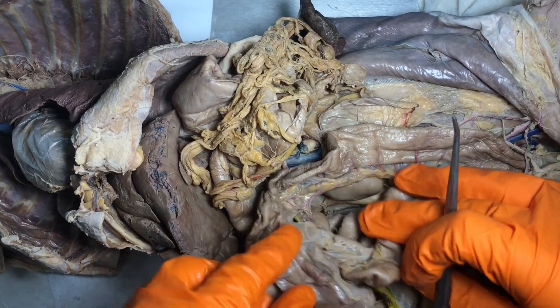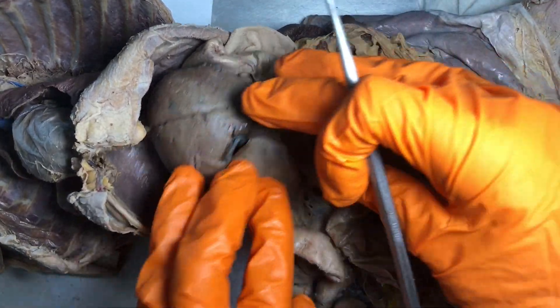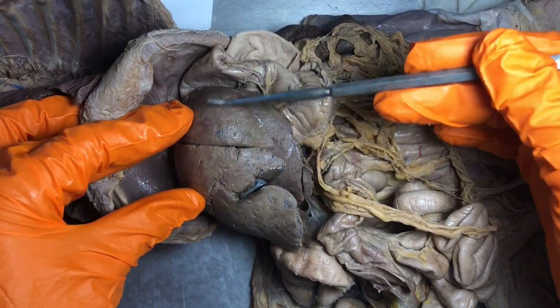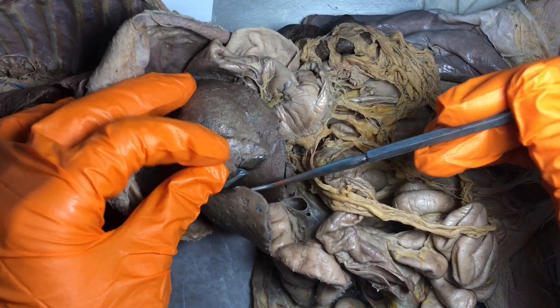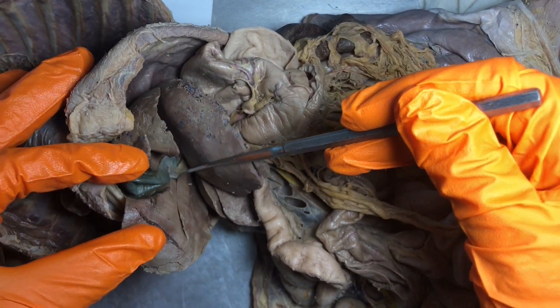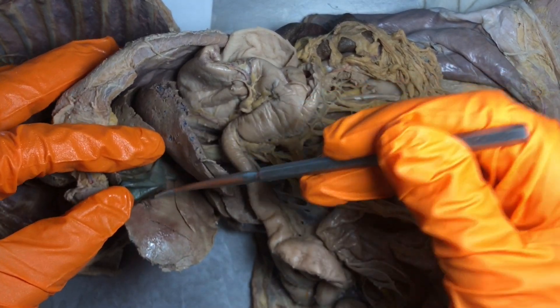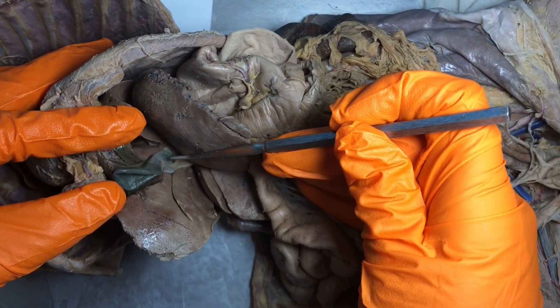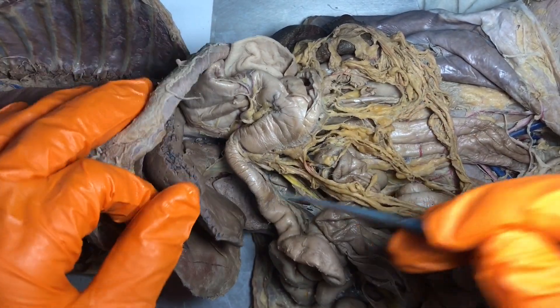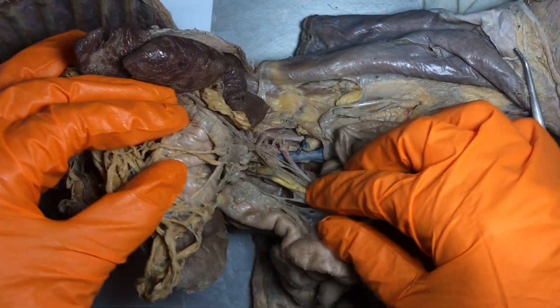Let's talk about the accessory organs. We have a very large liver. And this little small thing that looks like a little deflated balloon — that is the gallbladder. This is actually a very nice gallbladder on this kitty. We also have the pancreas, which is in my personal opinion the hardest organ to find on the cat.